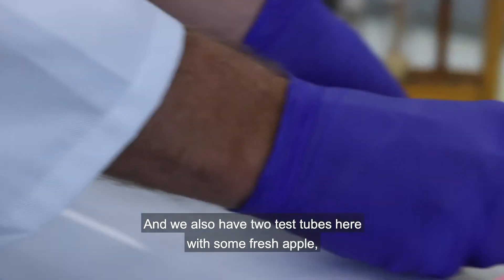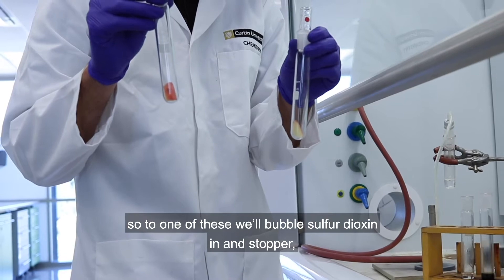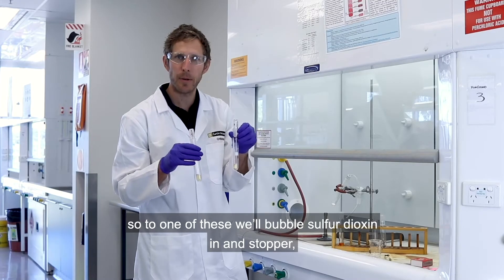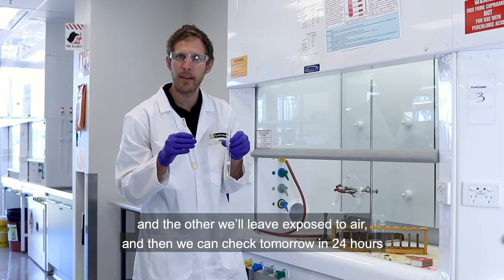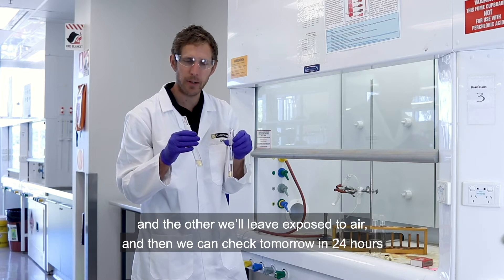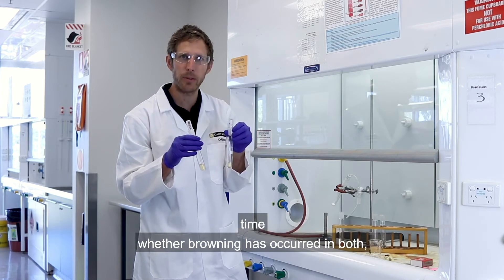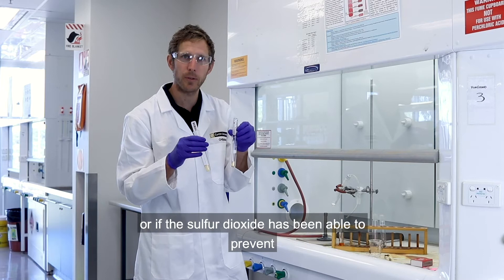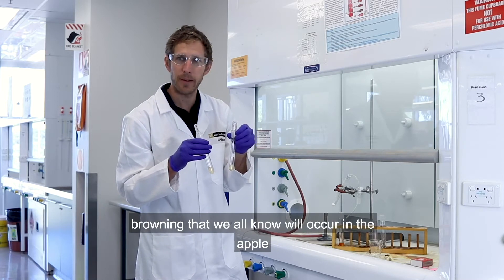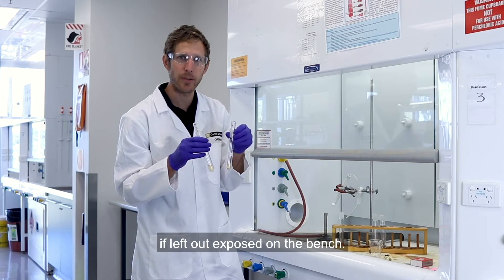We also have two test tubes here with some fresh apple. To one of these we'll bubble sulfur dioxide in and stopper it, and the other we'll leave exposed to air. We can then check tomorrow in 24 hours' time whether browning has occurred in both, or if the sulfur dioxide has been able to prevent the browning that will occur in the apple if left out exposed on the bench.